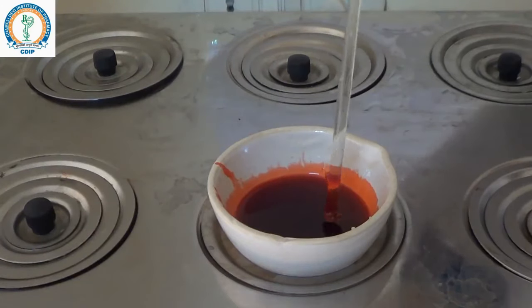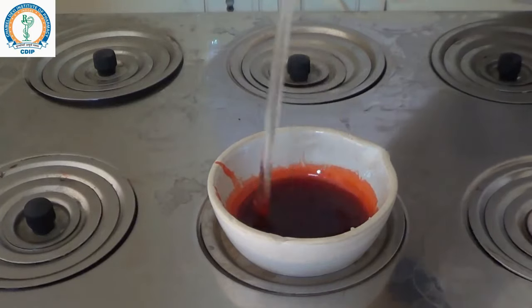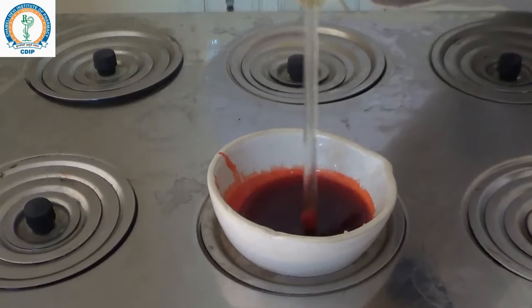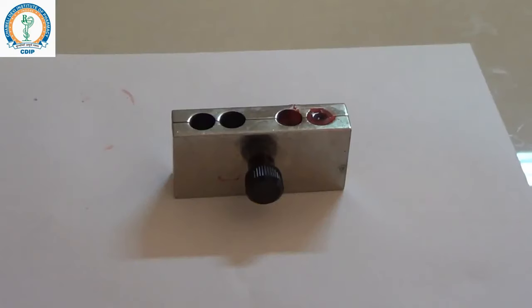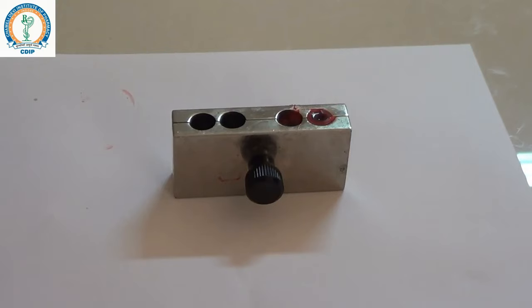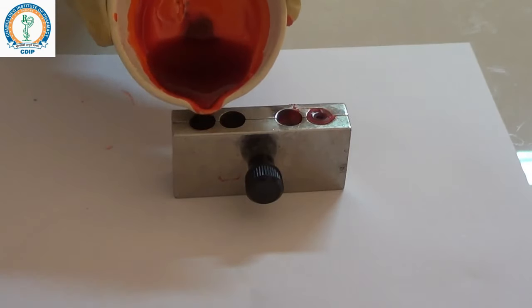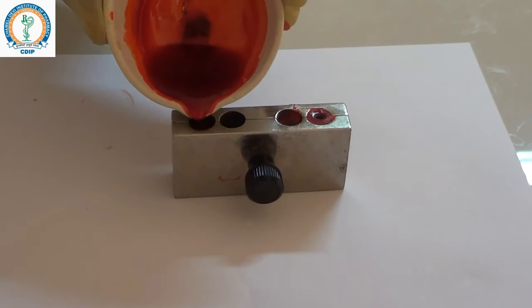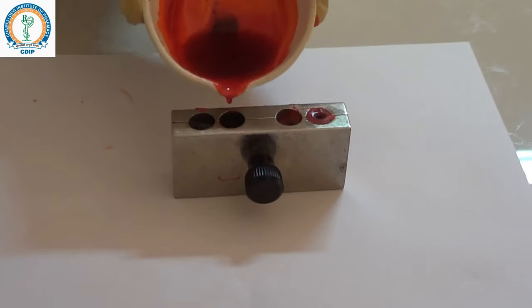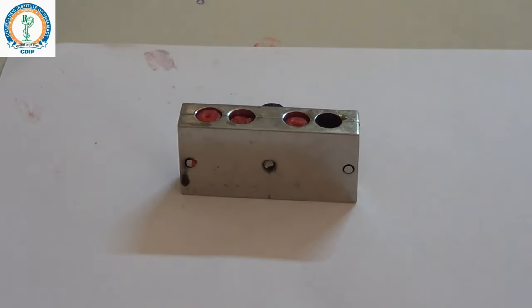Now you can see a uniform mixture of lipstick has been prepared. The mixture is removed from the water bath. After removal, pour it into the mold and refrigerate it. After refrigeration for 15 minutes, the lipstick is ready.